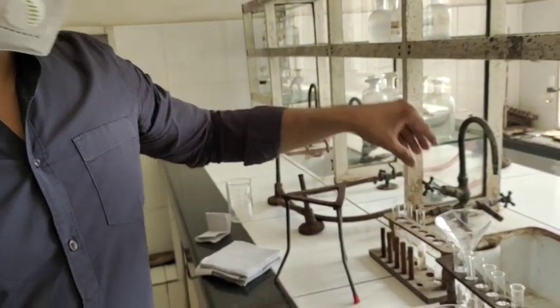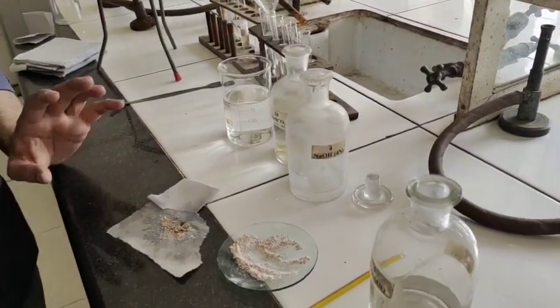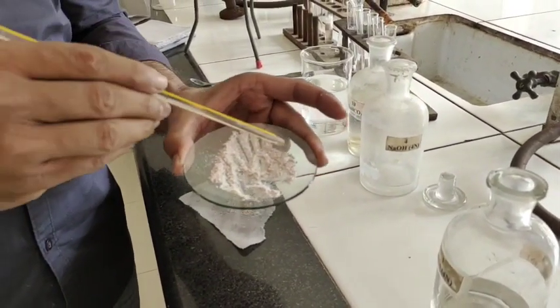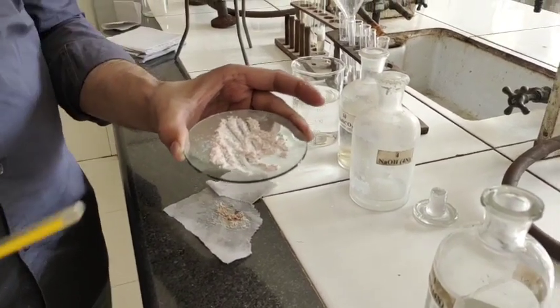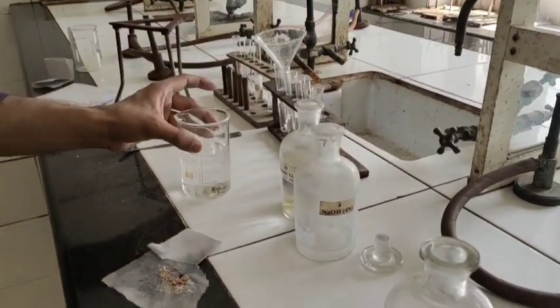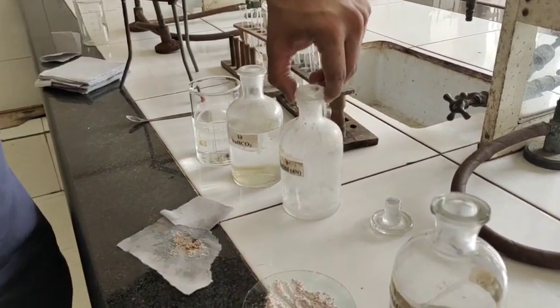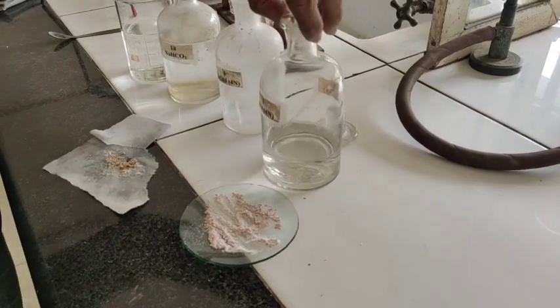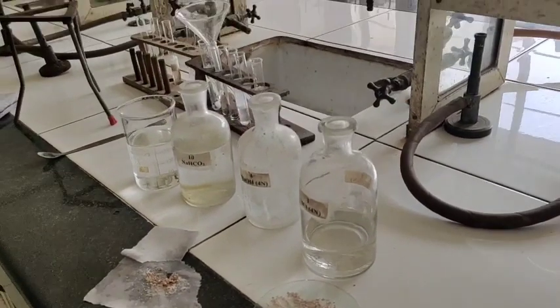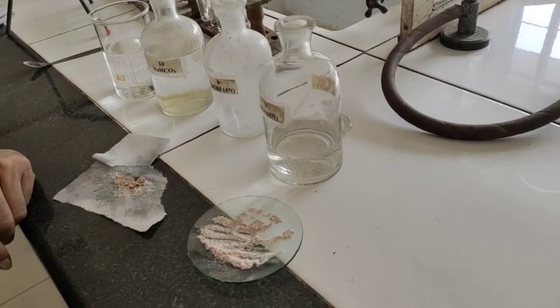Let me quickly revise in 30 seconds. We have an organic binary mixture — two organic compounds. It could be acid, phenol, base, neutral, any combination. Start with water to check solubility. Sodium bicarbonate for carboxylic acids. Sodium hydroxide for phenols. HCl for bases. Neutral compounds do not react. After carrying out the experiment, we conclude the given organic binary mixture was water-insoluble acid plus water-insoluble phenol. Thank you.